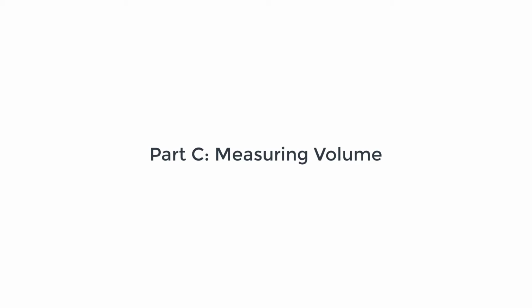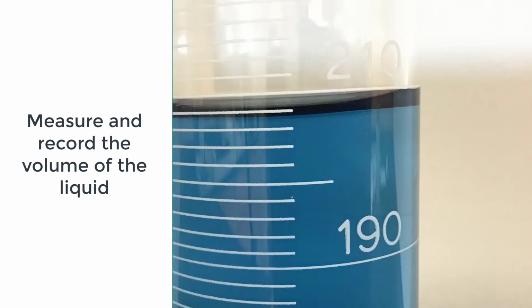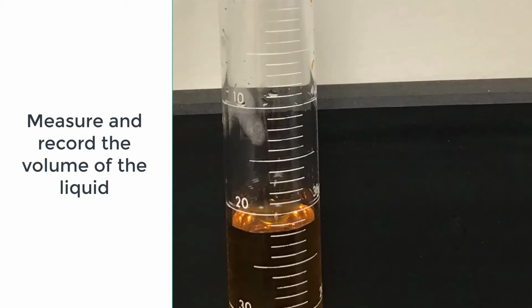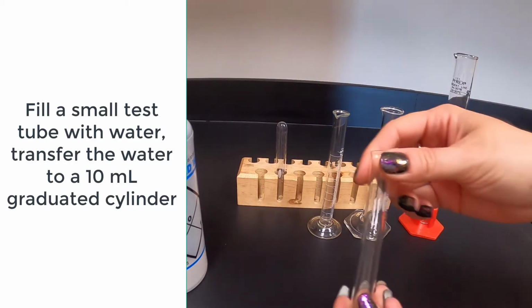Part C, Measuring Volume. Measuring with graduated cylinders. Record the volume of the liquid in the 3 graduated cylinders. Resolution and graduated cylinders.